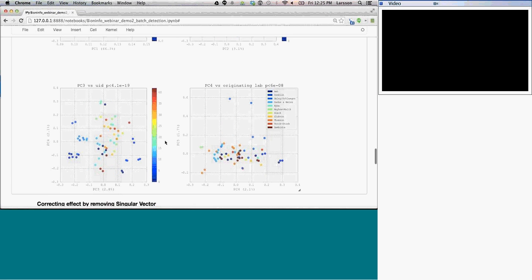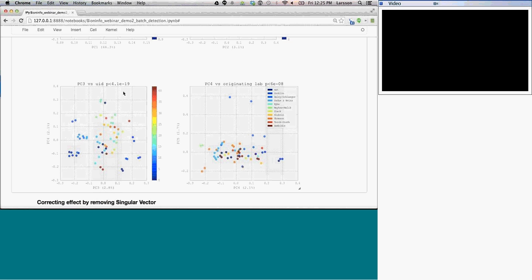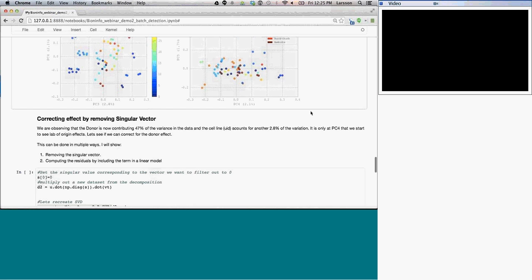If we go down further, we can see that PC3 again is associated with these cell lines, very strongly so, with a p-value of 10 to the minus 19. And this is done using a chi-square test, basically a generalization of it. And then all the way at PC4, we're seeing an effect of lab. So this is very good news. Basically we're seeing that donor is the strongest association in the data, then we have a little bit of information from cell lines, but lastly, lab of origin has an effect as well.